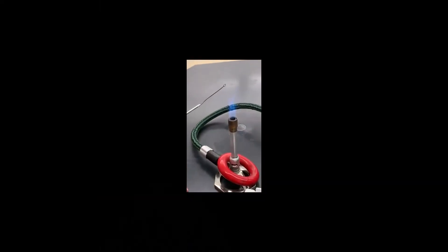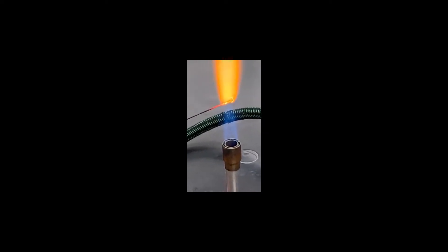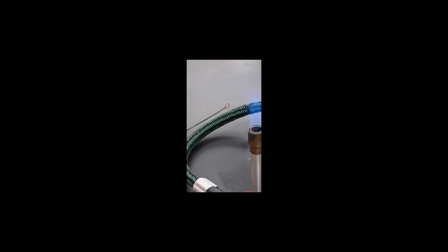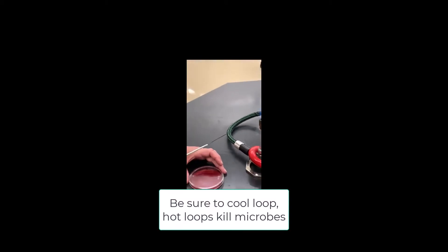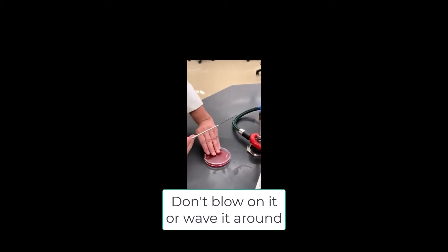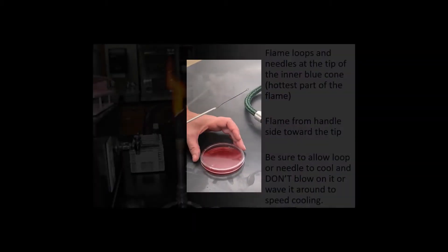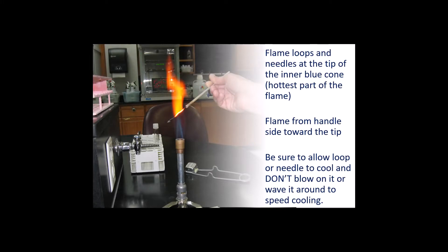If you had a clump of bacteria on the tip and you insert it right into the hot part of the flame, the bacteria will dry very quickly and splatter all over into the air. After sterilizing the loop or needle, it will need to cool. It's really tempting to just blow on it or wave it around in the air to cool it — but don't do it. Those actions will just increase the risk of contamination.